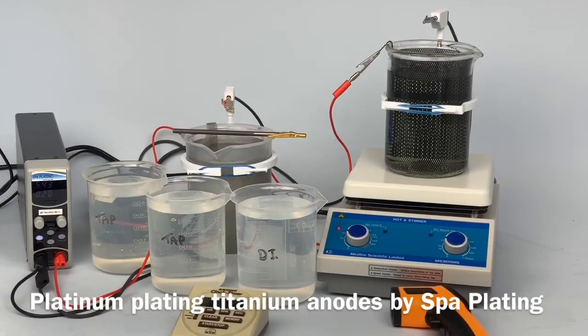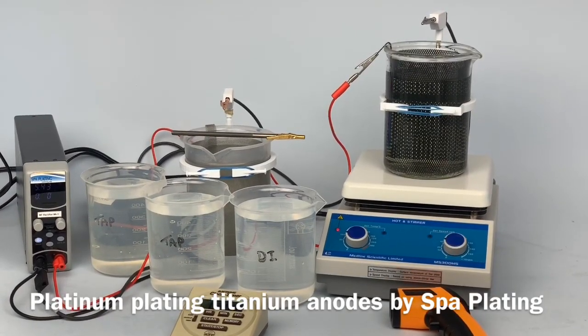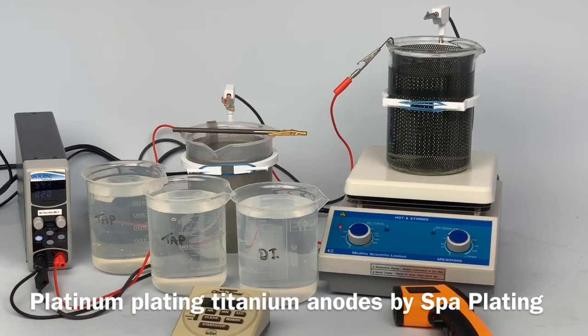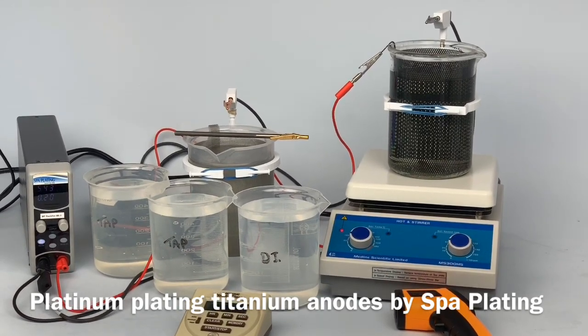This video will show our platinum tank plating solution being used to platinize one of our titanium electrodes.